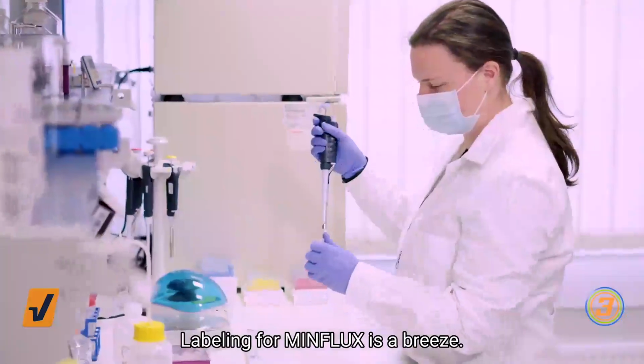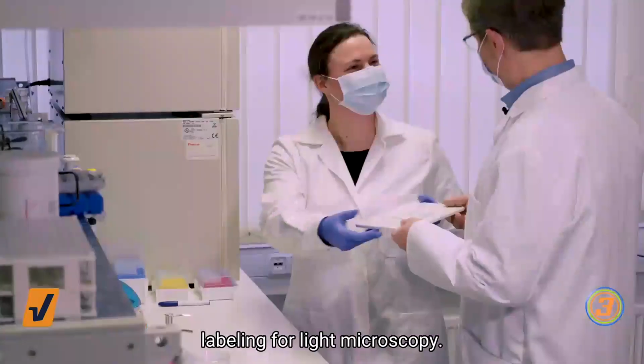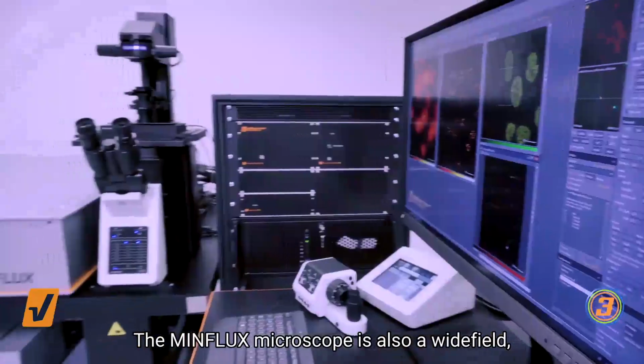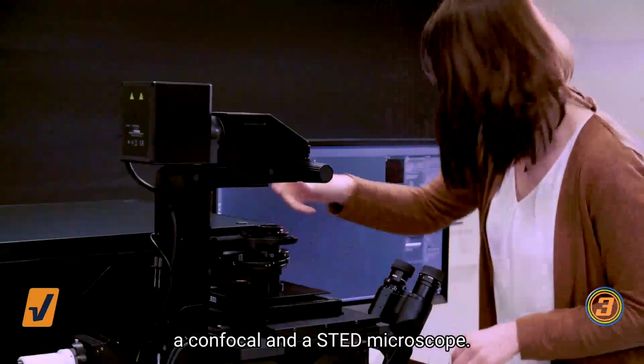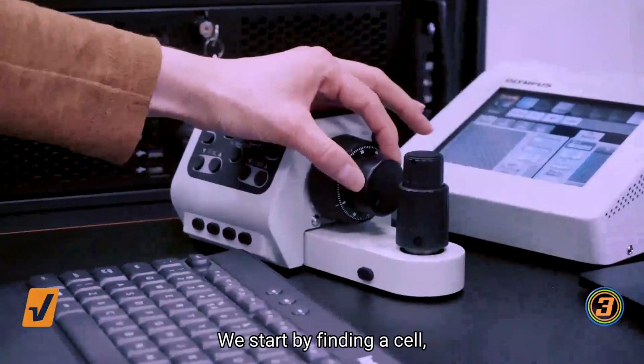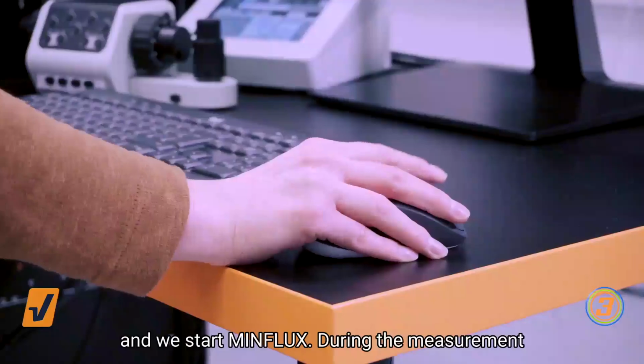Labeling for MINFLUX is a breeze. It's pretty much standard labeling for light microscopy. The MINFLUX microscope is also a widefield, a confocal, and a STED microscope. We start by finding a cell, we focus, we pick a region of interest, and we start MINFLUX.